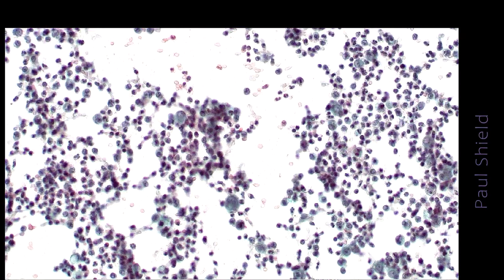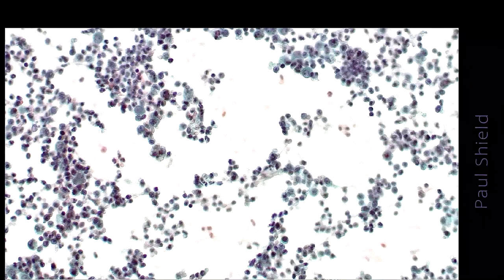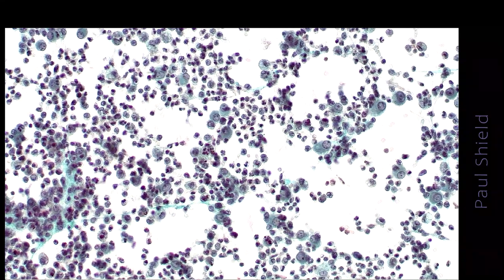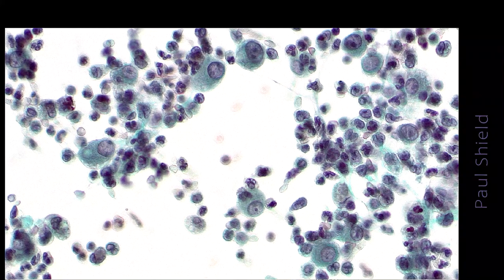Here is a pap stain specimen. Notice how cellular this is. So this case is reactive, and this is like a gradation of change really, but this increased cellularity is one of the features of that. Increased numbers of groups and increased numbers of cells with prominent nucleoli are all features of reactive change.